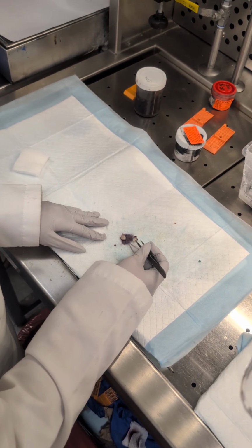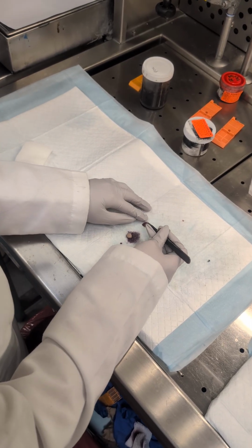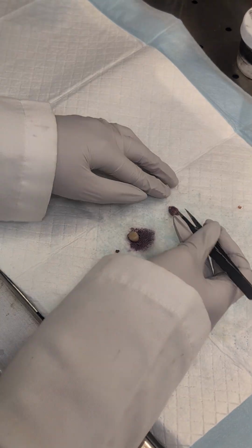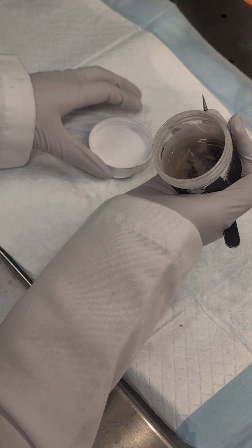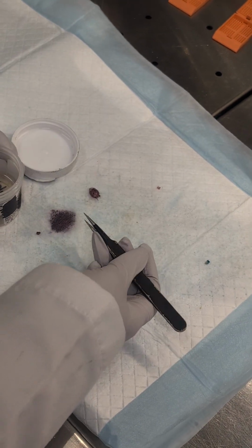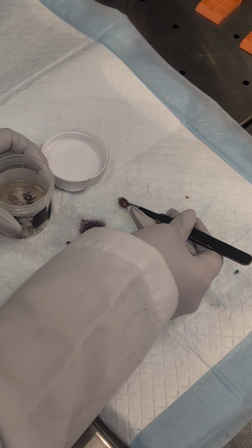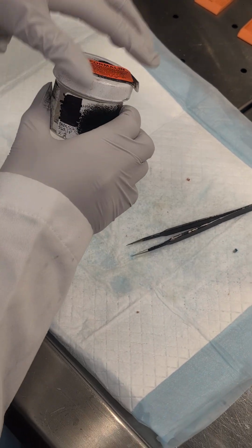Just trying to cut it into small pieces so that you guys each have enough. Okay? But that's how you would gross this cyst, so the rest of this can go back in there. If we want to save this for the other group, I would be okay with you guys cutting this into fourths, just as long as you saw this is how you would actually gross it, okay?